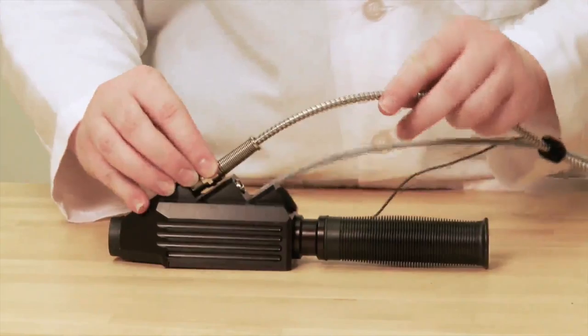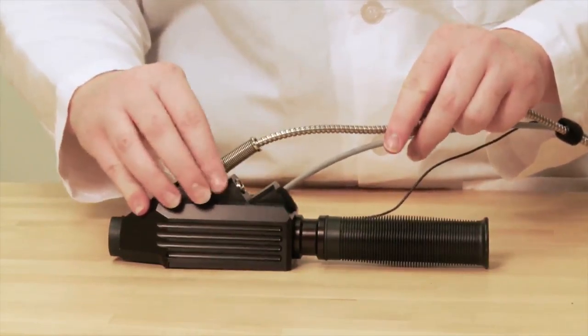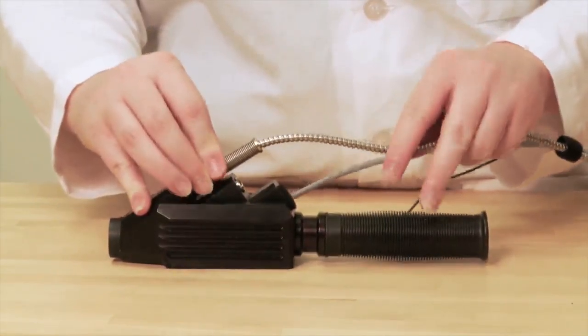While still holding the cable in place, slide the metal strain relief onto the accessory connector and screw it into place.